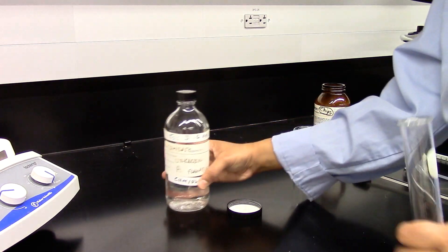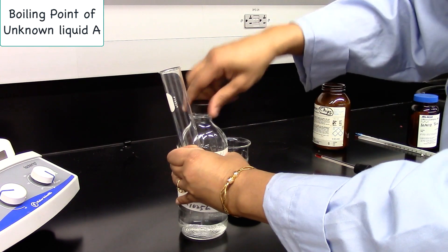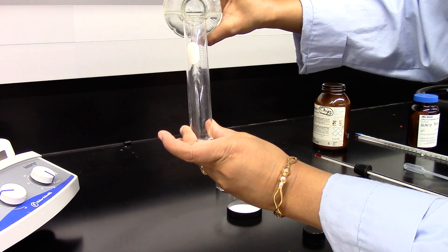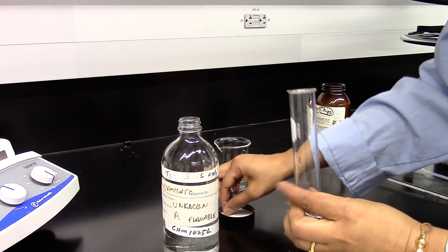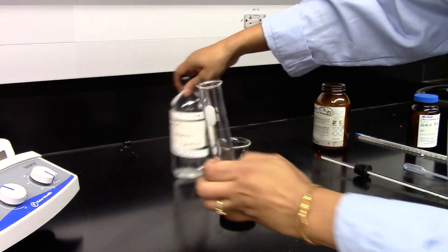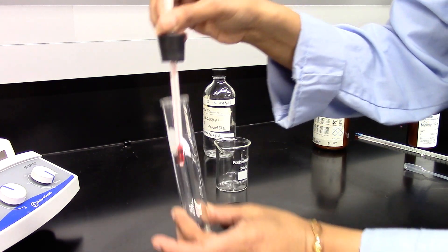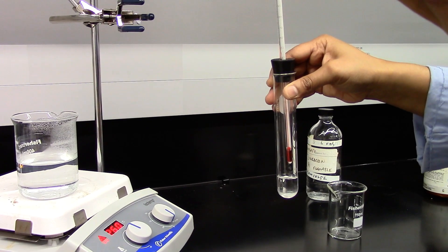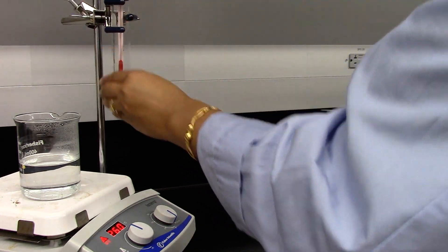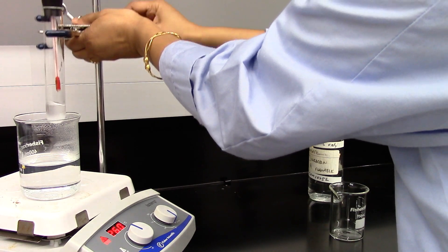For part C unknown, I am using unknown A. I am going to use about 5 ml of the alcohol. I will add a boiling stone and then use the thermometer with the stopper, and I am going to clamp it above the hot water beaker. Once it is clamped, I am going to lower it down into the hot water.